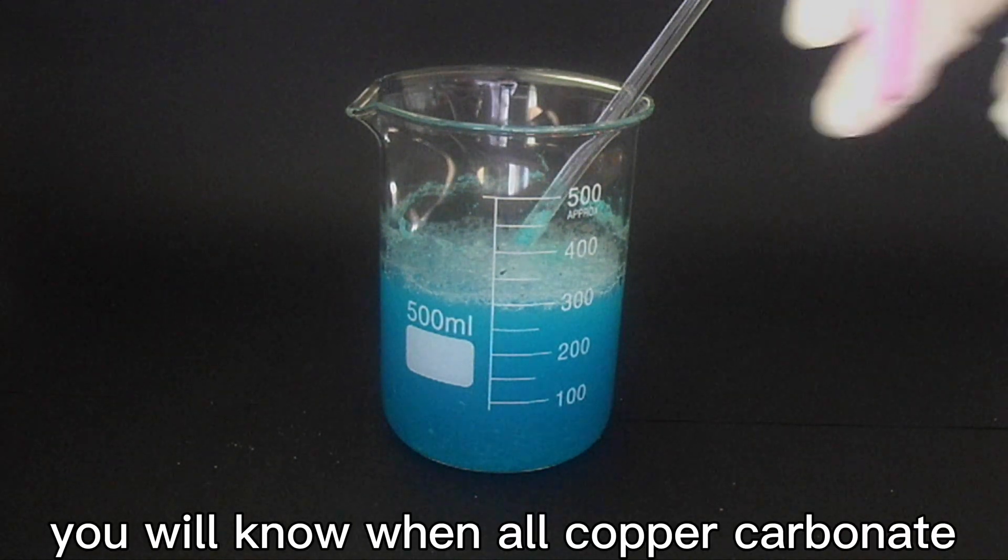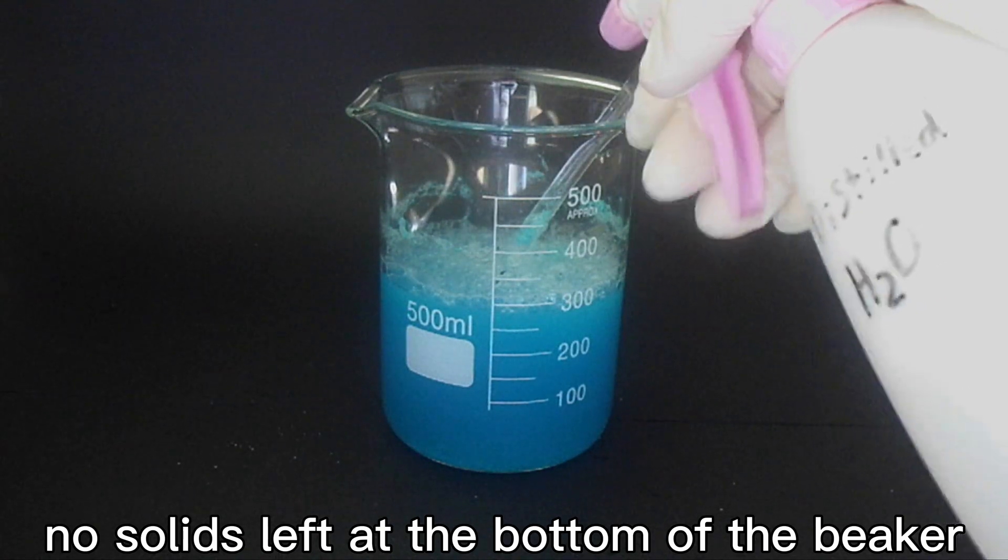You will know when all copper-carbonate has reacted because there will be no solids left at the bottom of the beaker.